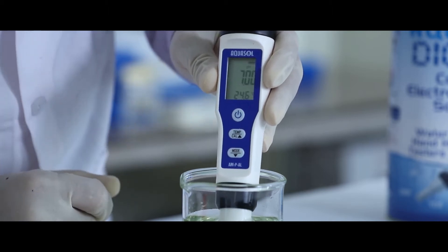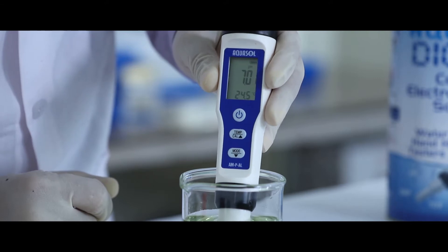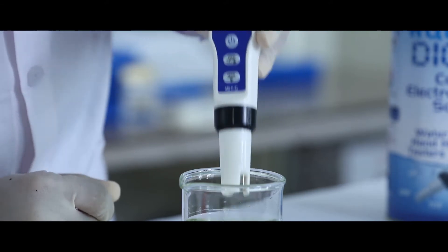Once the calibration is done, the display will flash. Repeat the same procedure for pH 4 and pH 10.